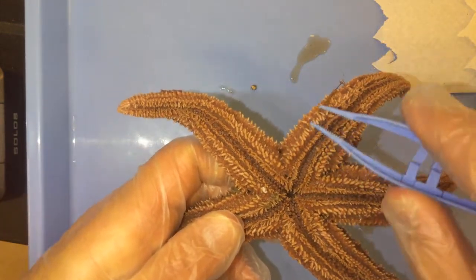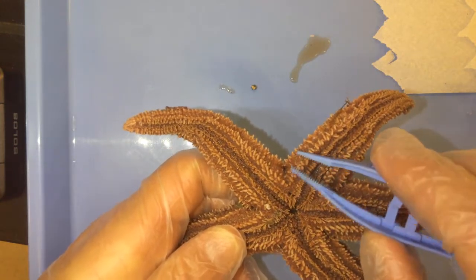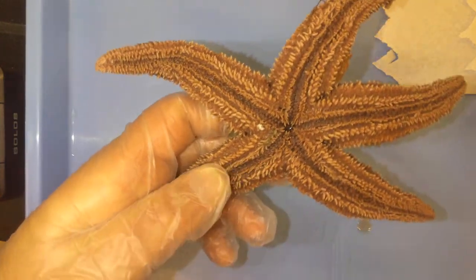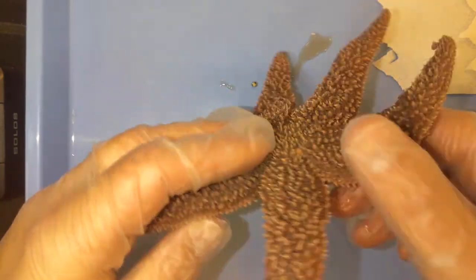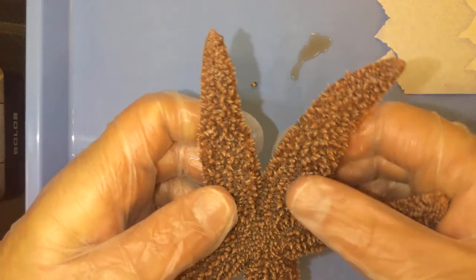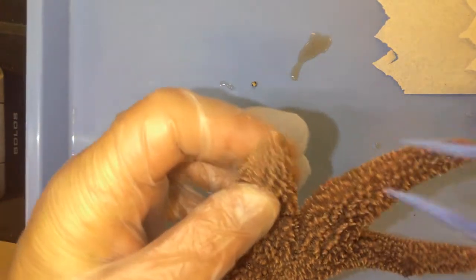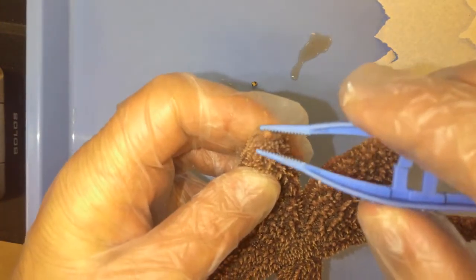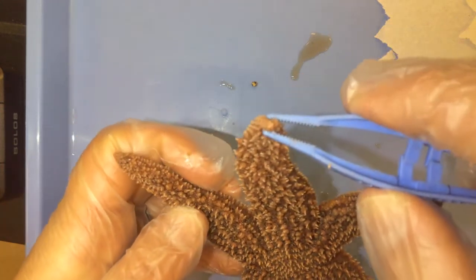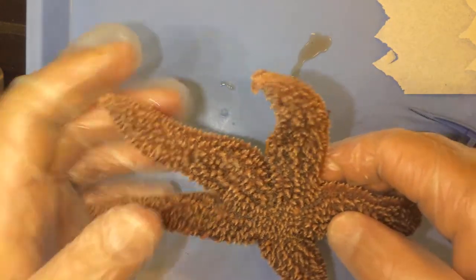We also see on the sides of the arm are the oral spines. Just like we saw on the dorsal side, there are also spines here at the bottom. An interesting fact is that at the tip of these arms — the terminal end — there are light-sensing cells at the very tips. These cells basically help the sea star to detect light and figure out which direction the light is coming from.